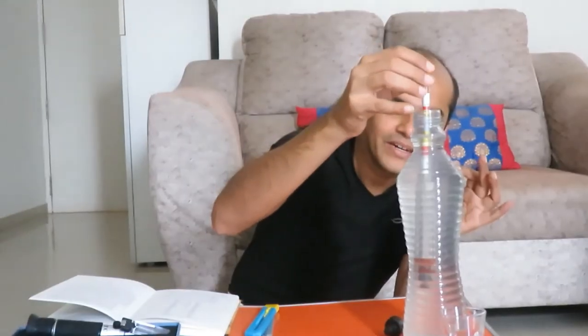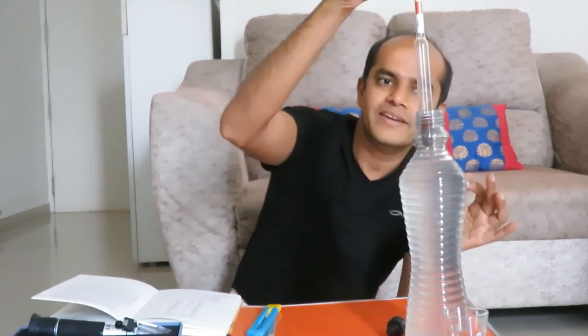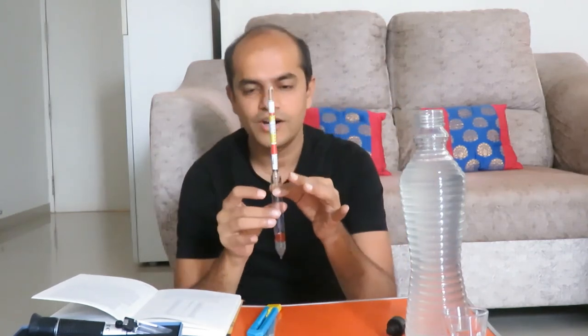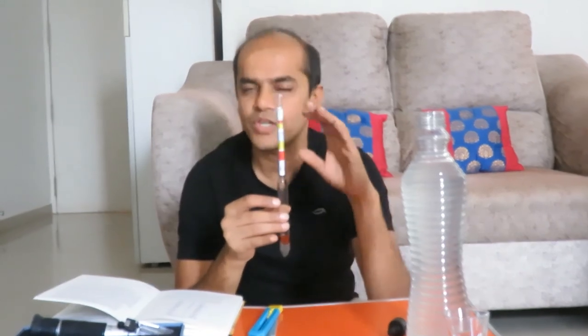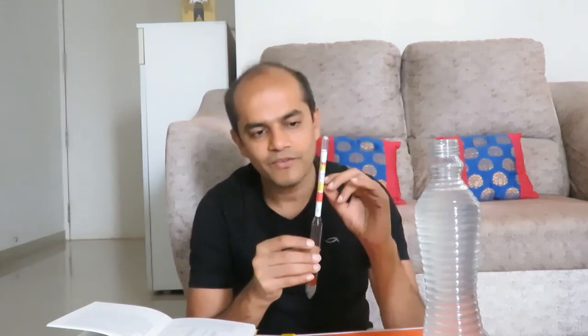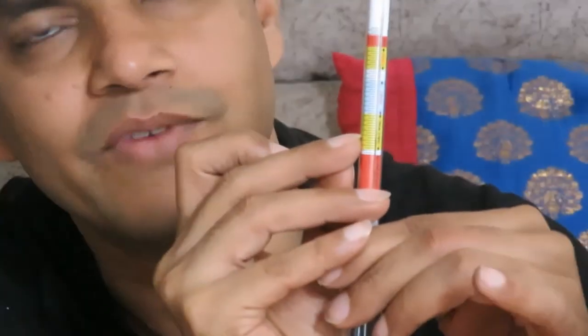There are six other points mentioned in the book. Once the hydrometer has settled — no longer rotating or moving up and down, and the surface is free of bubbles — we take our reading. As shown here, this hydrometer is reading at 19 Brix. This is a triple-scale hydrometer which is color-coded for visual convenience, though a non-color-coded hydrometer is equally accurate. A reading of 19 Brix means every liter of solution contains 190 grams of sugar.